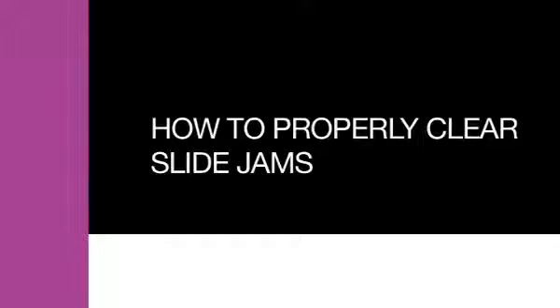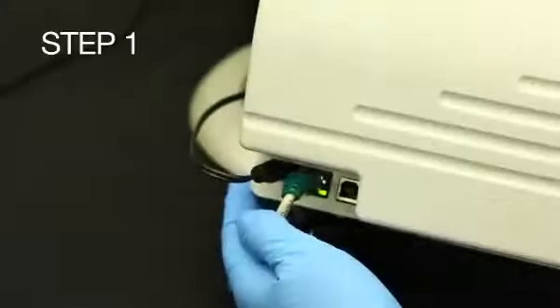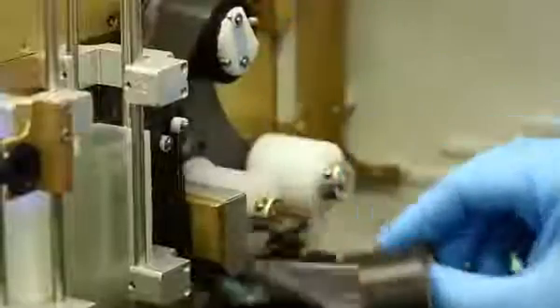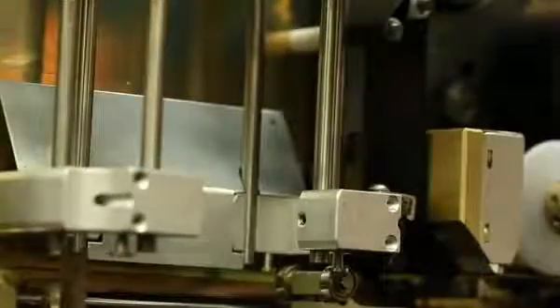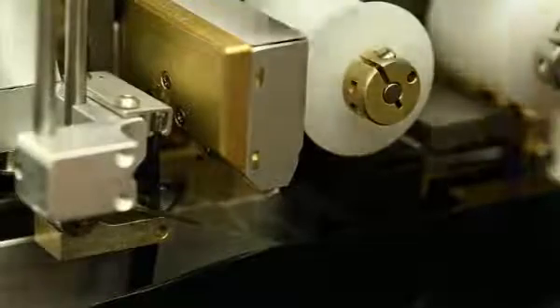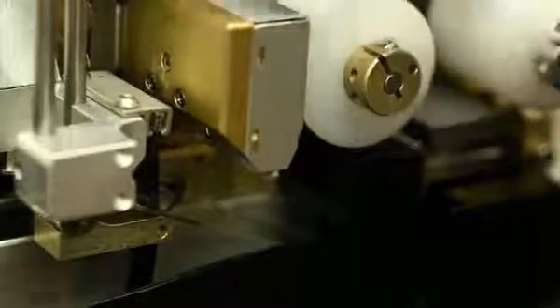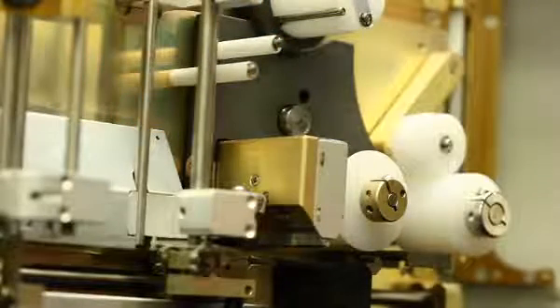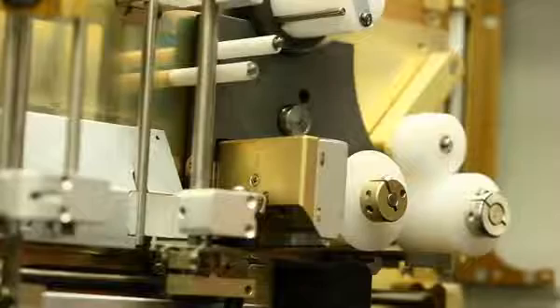How to properly clear slide jams. Step 1. Power SlideMate off. Remove the ribbon and slides from the slide holder. Step 2. The print head moves up and down approximately 10 millimeters. If the print head is not in the up position, move it up by pushing the ribbon printer output guide.